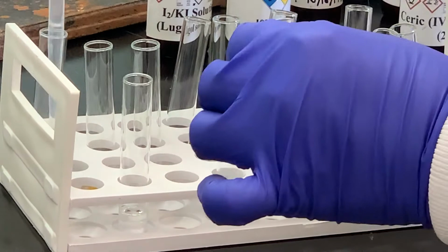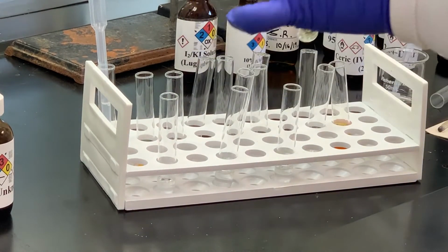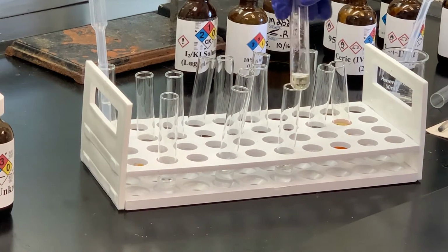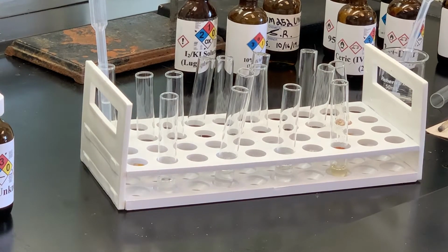So now that leads us to the sulfuric acid. Add a few drops there. Stir that up, and if you notice, you do not see any type of layer up on top. So we would say that our sample unknown is soluble in sulfuric acid. Again, what does that do when we try to determine what class of functional groups? We've already talked about that before: aldehydes, ketones, alcohols, esters, and so on. So next we're going to do some chemical tests and hopefully fine-tune what this functional group is.